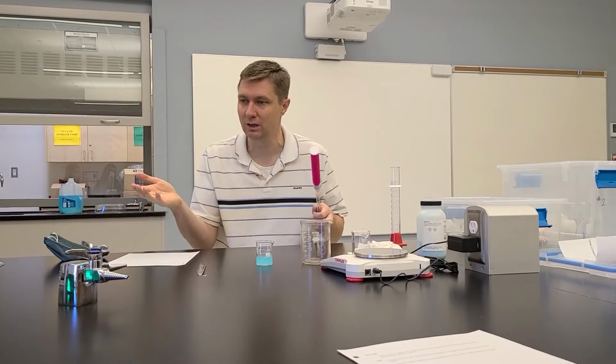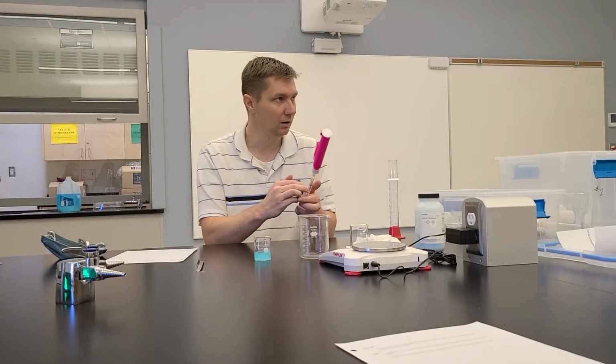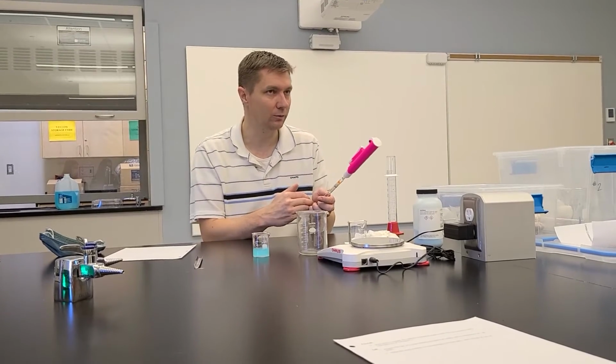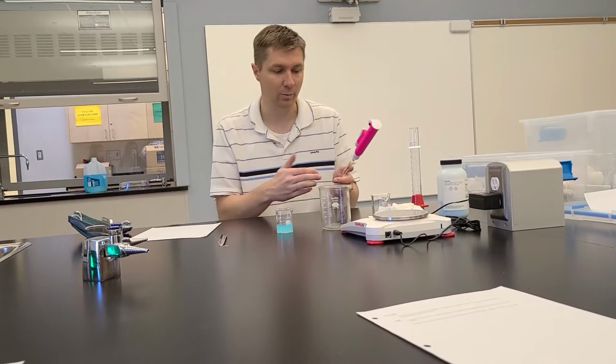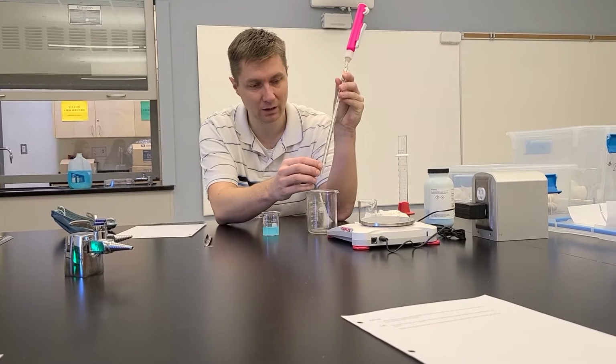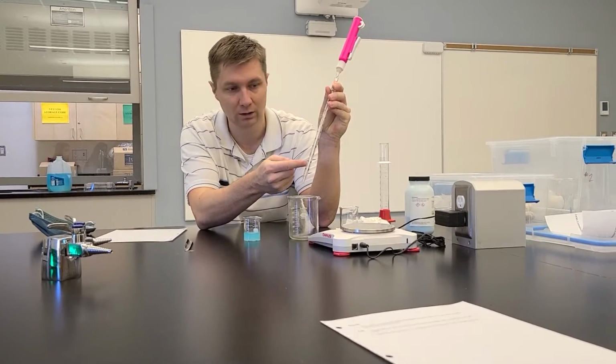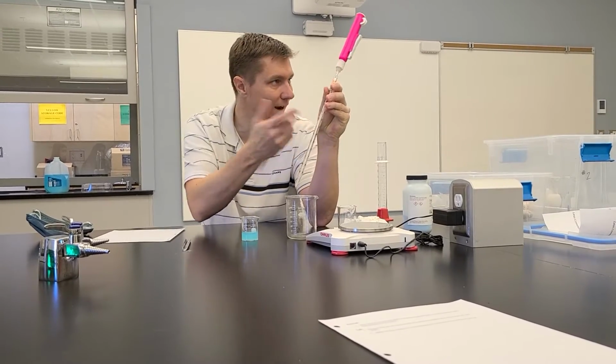If your number that you calculate, which it will be, is larger than 10, then just pipette 10, and then pipette another amount, whatever that is, added together, right? So if you're gonna pipette 12 milliliters, then pipette 10, and then pipette 2 more. And so with this, you can see on the number scale here, to go 2 more milliliters, you would go 9 is 1, and 8 is 2, right? The numbers just go backwards.